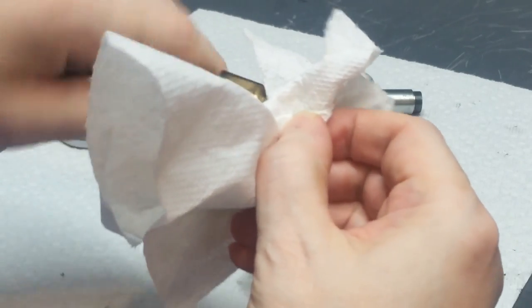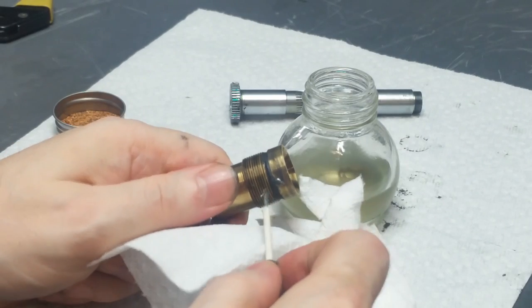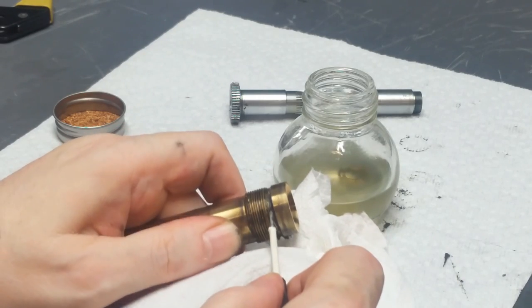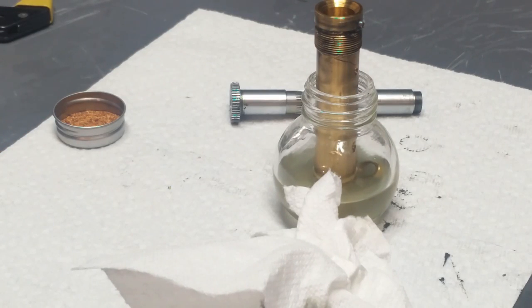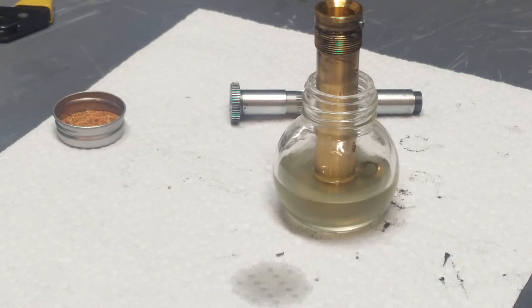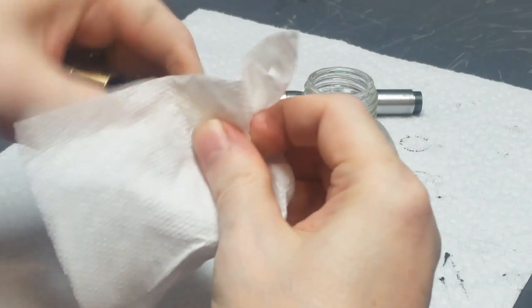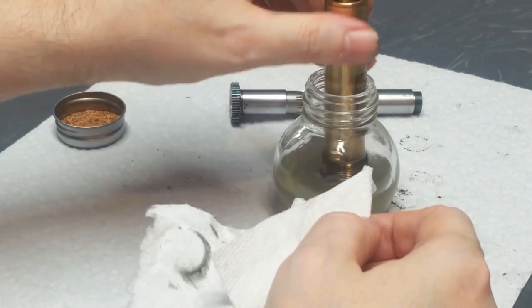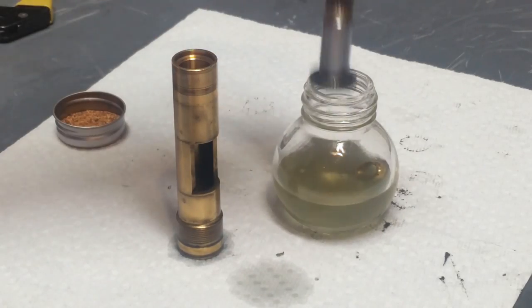Sometimes, depending on what kind of grease is on here, if it's the original grease or whatever, I use mineral spirits, other times I use acetone. It just depends. I think in this case I might end up using acetone because some of this stuff does not look original necessarily, but it's still in there. Let's do this side for a while. This side cleaned up pretty well, so let's give this a little more time in the soak. Now while I try to clean this, I'll have this one soaking.